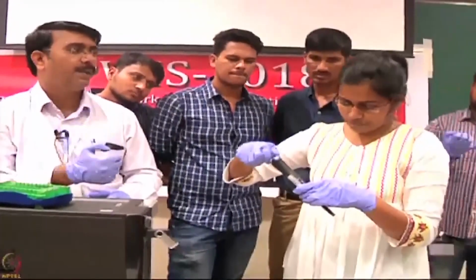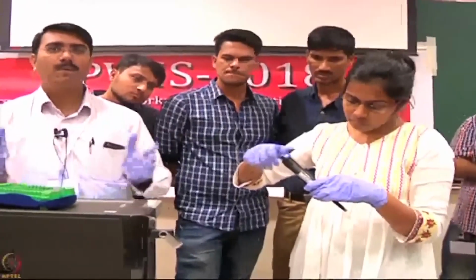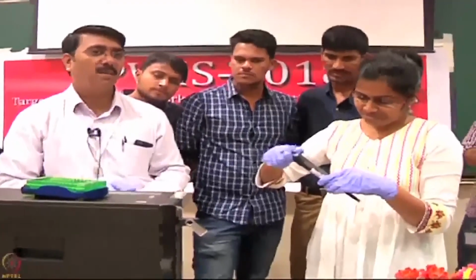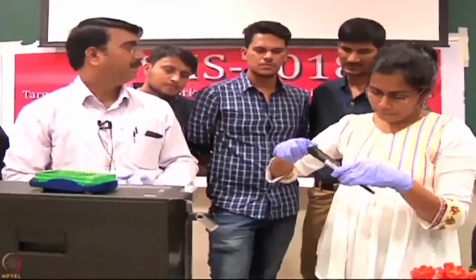Thoroughly pipette and mix it properly. I wanted to let you guys feel how exactly it is. It's very simple to operate.